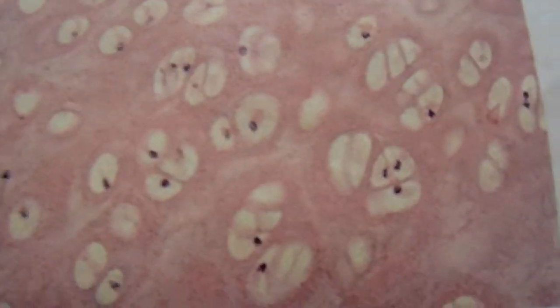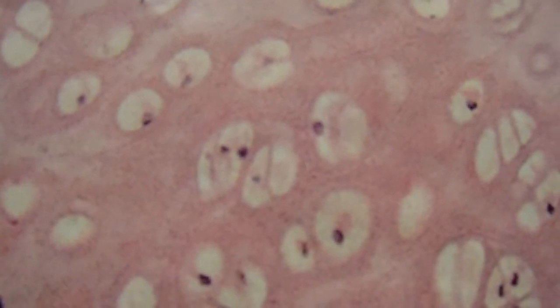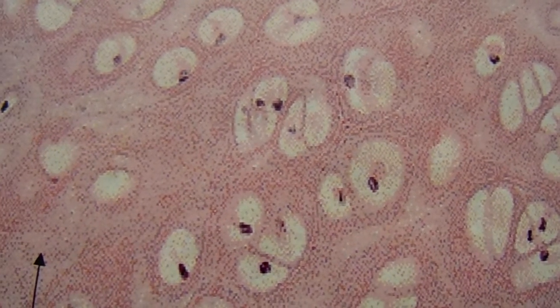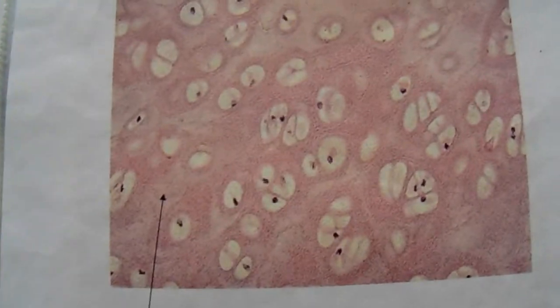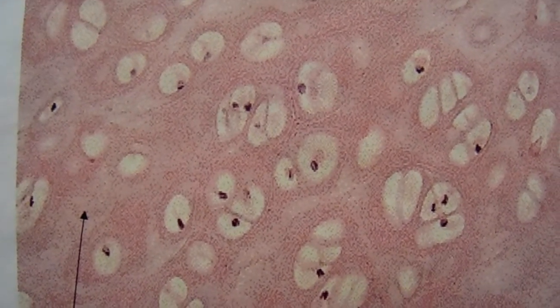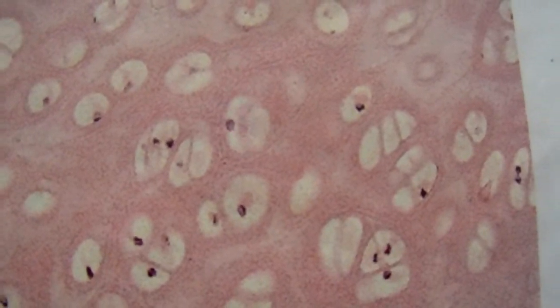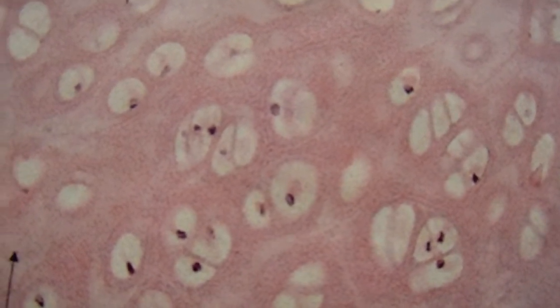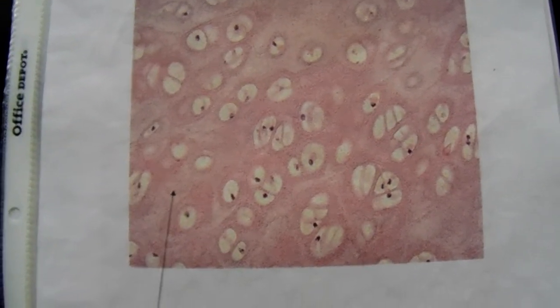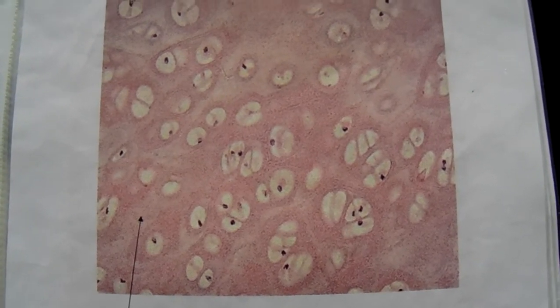This is our first type of cartilage. This is hyaline cartilage. It's found in our nose. It's found between the sternum and the ribs. It's found at the end of bones. The embryo's bones are made of this hyaline cartilage. See that? There's chondrocyte cells. The pink area is the matrix. The matrix is the gel-like material. The cells are called chondrocytes in the lacunae cavities. So that is the most numerous type of cartilage in the body. And this is a microscopic view of it. It is hyaline cartilage.